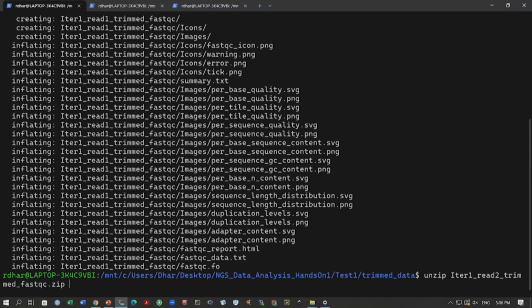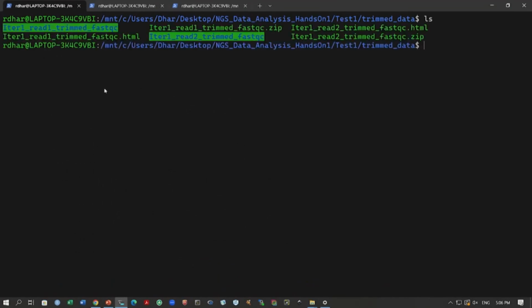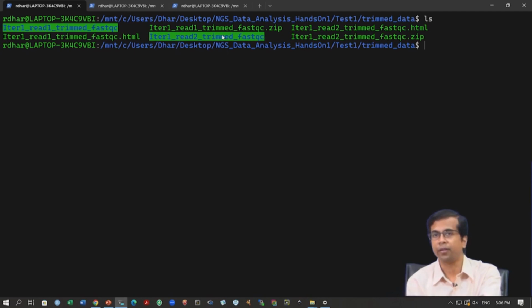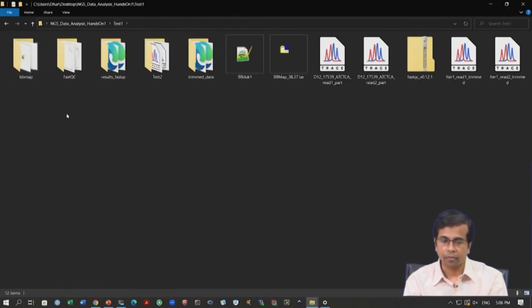We have done this for read 1, now we do it for read 2, and we have generated these folders. Okay. So, we have this fastqc folder for two reads, 2 data sets, and then we can now go inside these folders and check the quality again. And the quality that we will be focusing on mostly is the adapter content. That was the problem earlier. We had adapter contamination in both of them. Okay. So, let us go into that folder and see what actually has happened.